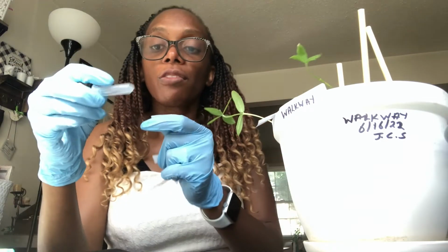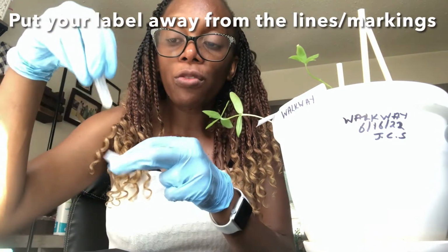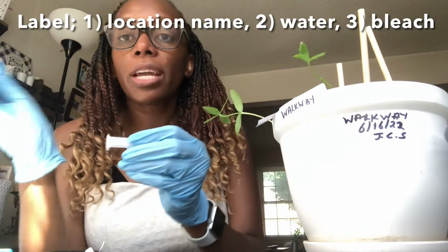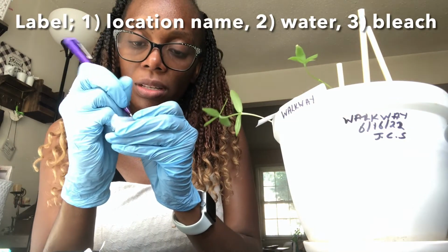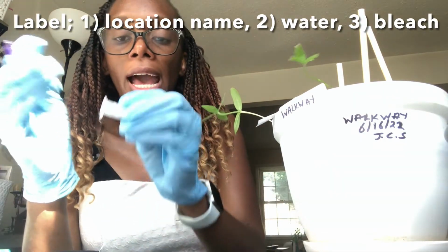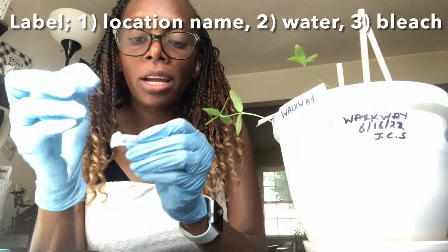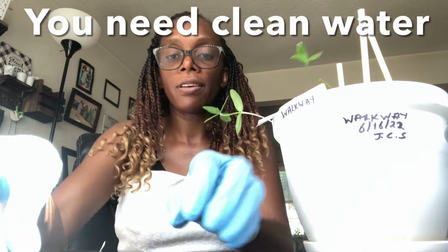So remember that. Even when you put your label, put it away from the marking so that you can actually see. And what do you put on the label? On the first label, please put the location that you're doing. So for me, it's going to be walkway. You can use a Sharpie or a pen. And then on the other one, you can just put water. And in the third one, you put bleach. Okay, so I have my 3.